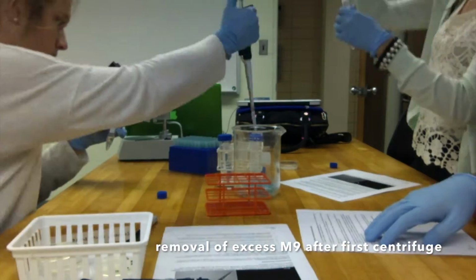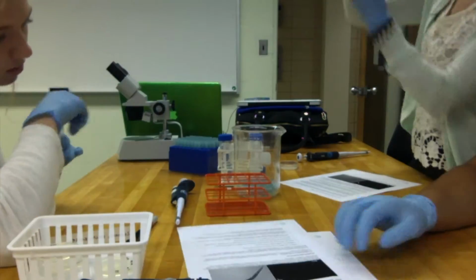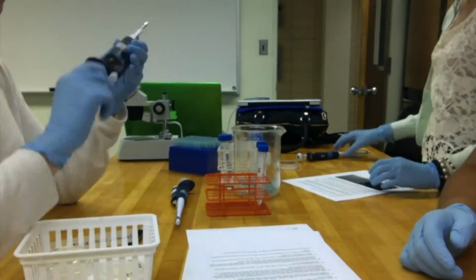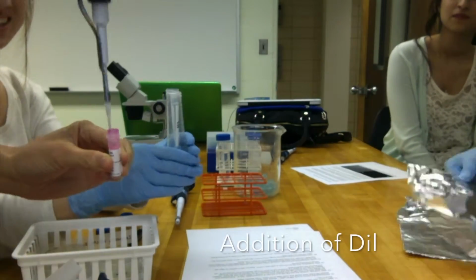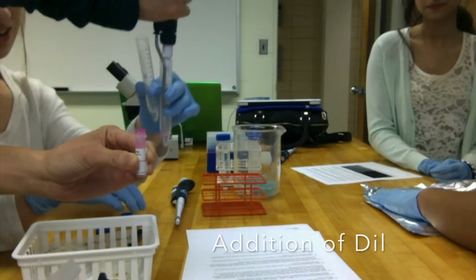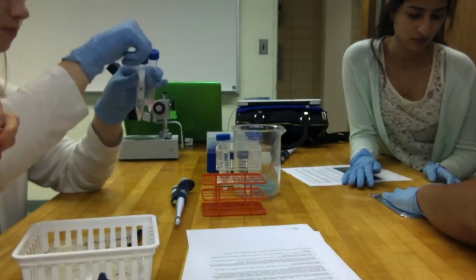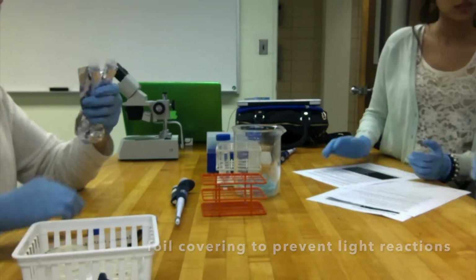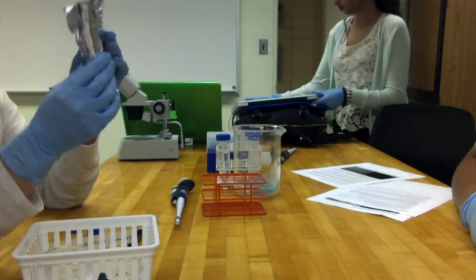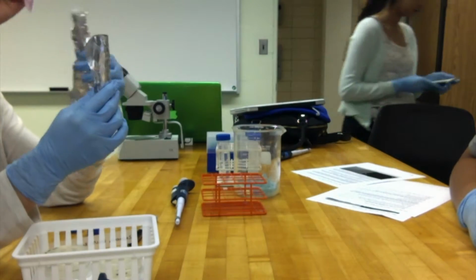After being centrifuged, the excess liquid was removed until approximately 500 microliters of the worm buffer and the worm pellet were left. 1 microliter of the red lipophilic fluorescent dye, DIL, was added to the tubes. The tubes were then covered with aluminum foil in order to protect the fluorescent DIL dye from reacting with light. The tubes were incubated for 1 hour at room temperature and inverted every 10 minutes for that hour.